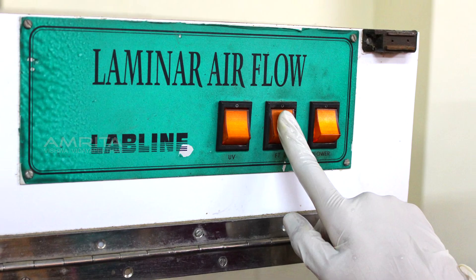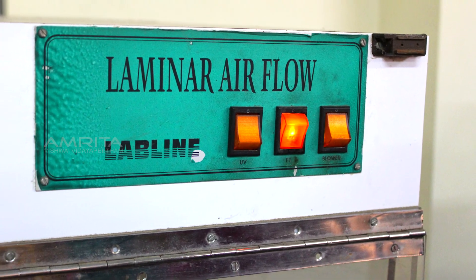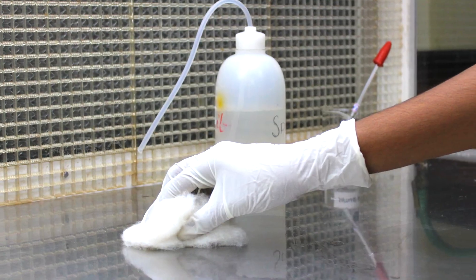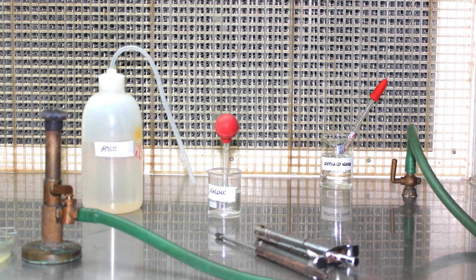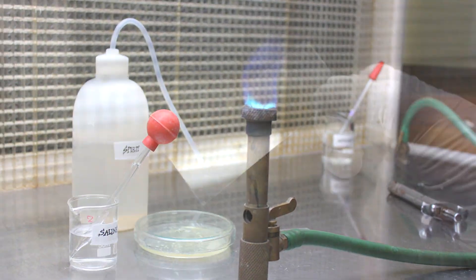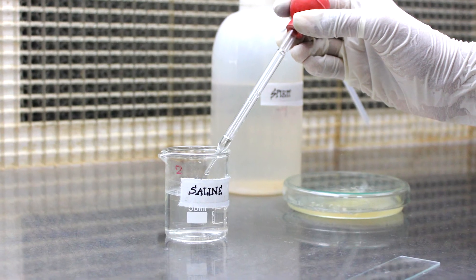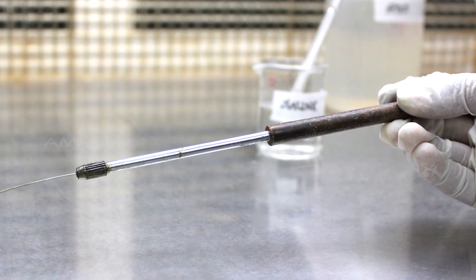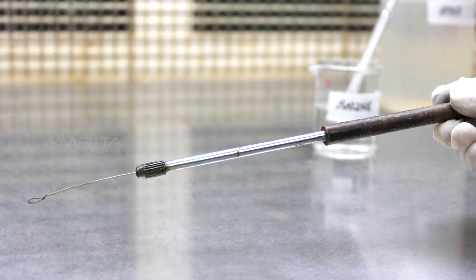We can start the procedure by switching on the laminar airflow chamber. To clean the chamber, pour some spirit and wipe it with cotton. Arrange all the required materials in the laminar airflow chamber and flame the Bunsen burner. Clean the slide using tissue paper and spirit, and transfer one drop of saline water to the slide. Then take a loop and flame it in the Bunsen burner until it becomes red hot and allow it to cool sufficiently.